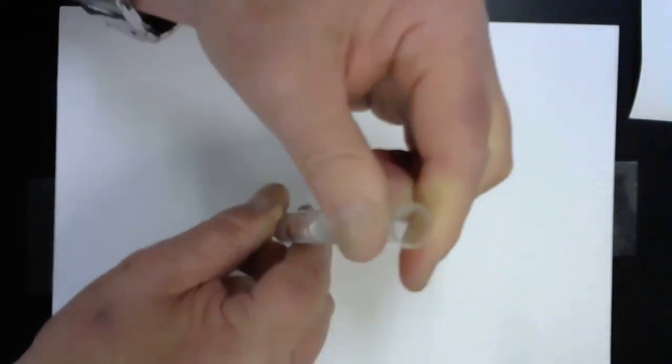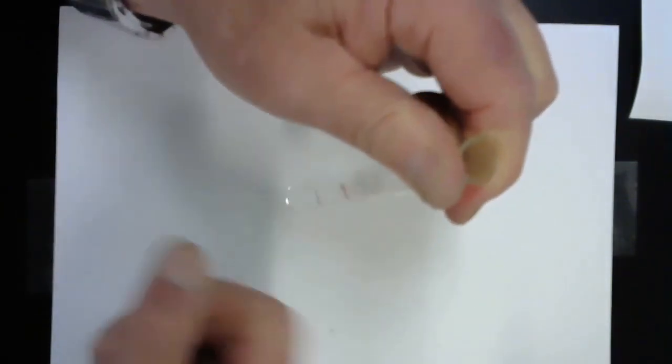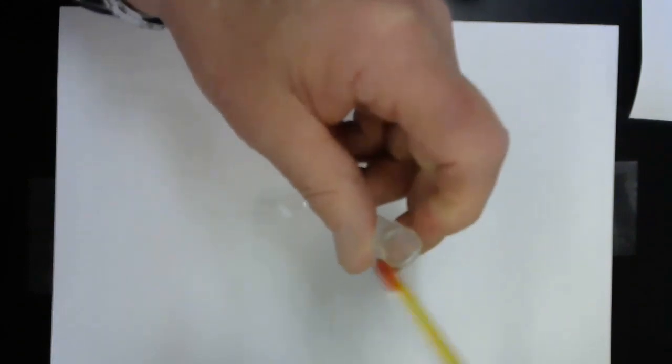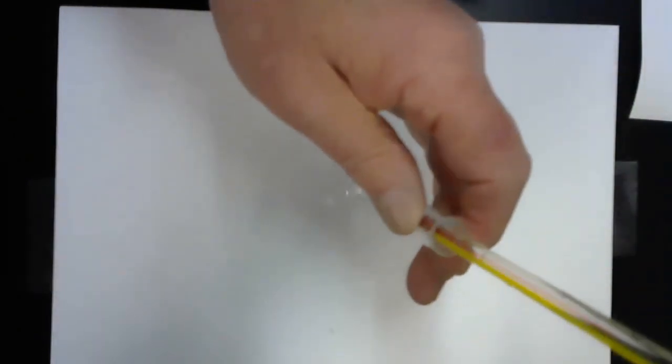All right. I can see mixing lines. I do not see any evidence of bubbles or precipitate. I'm mixing now. This is a good trick for mixing. If you hold the top of the test tube firmly and flick the bottom, it mixes the two solutions together, but it doesn't come flying out the top of the test tube. All right. I can feel the test tube is getting warmer though.